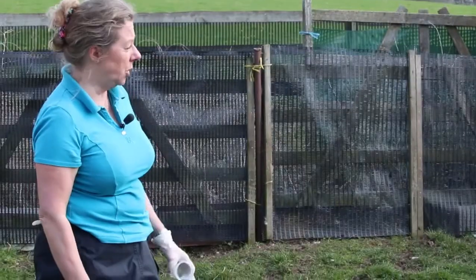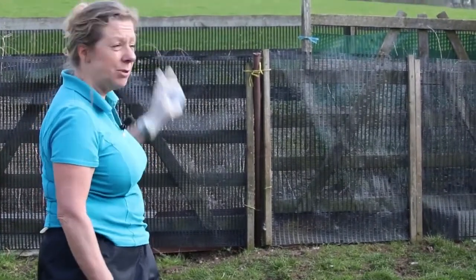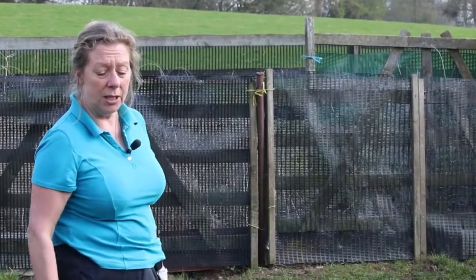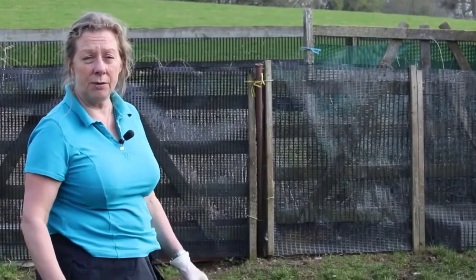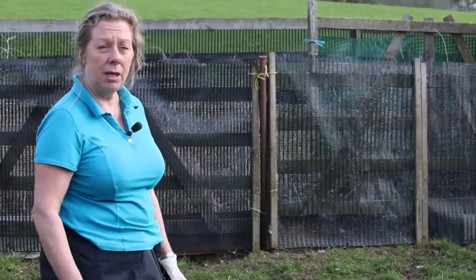The other way you can do it is to go out first thing in the morning, which is probably the best approach when they're out in the field. Particularly if you're wanting to sample young lambs, usually as they get up and stretch for the first time, a lot of them will deposit a nice fresh sample, so you can just go and pick it up in the field.